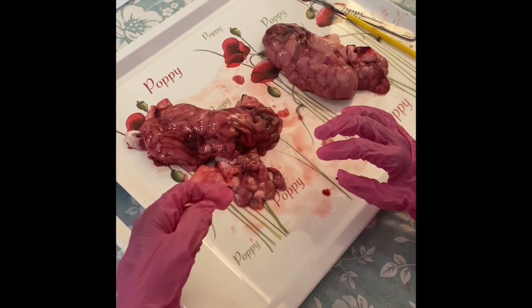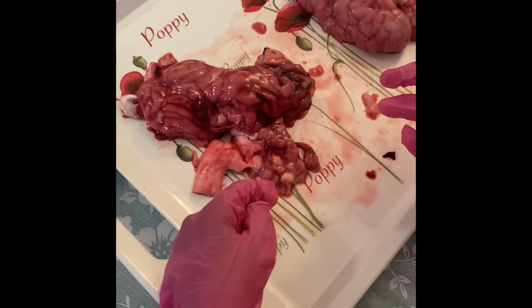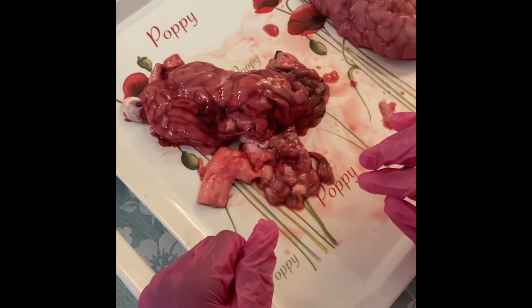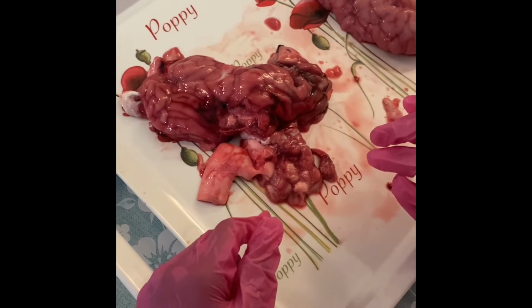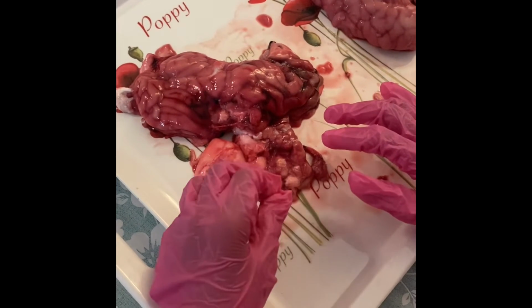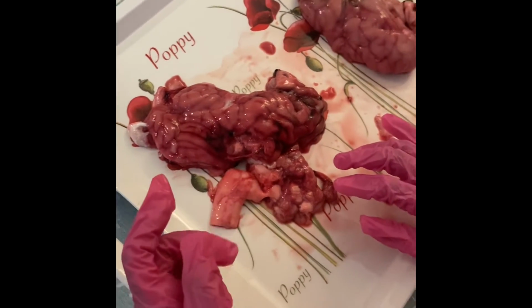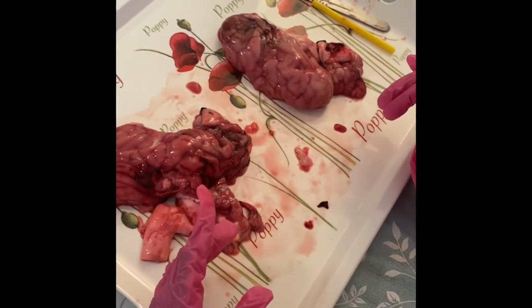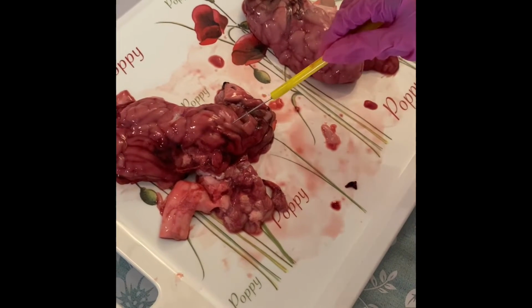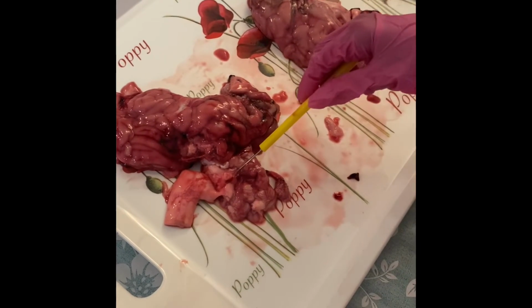So Elia is beginning her dissection. Elia, can you smell anything? No. It doesn't have a strong smell, does it? It's quite clean. We had washed it before we did anything. Can you touch it with your fingers? Tell me what the texture feels like. Wet and squishy. Wet and squishy, yes. You have your surgical tools. And if you need a clean tool, please ask your assistant for a clean one. I don't want your dirty hands going anywhere, touching anything else.